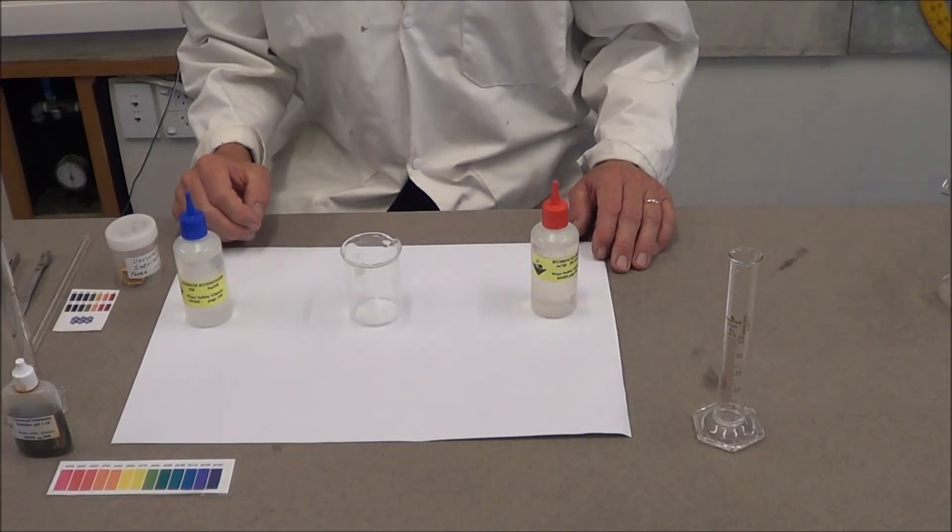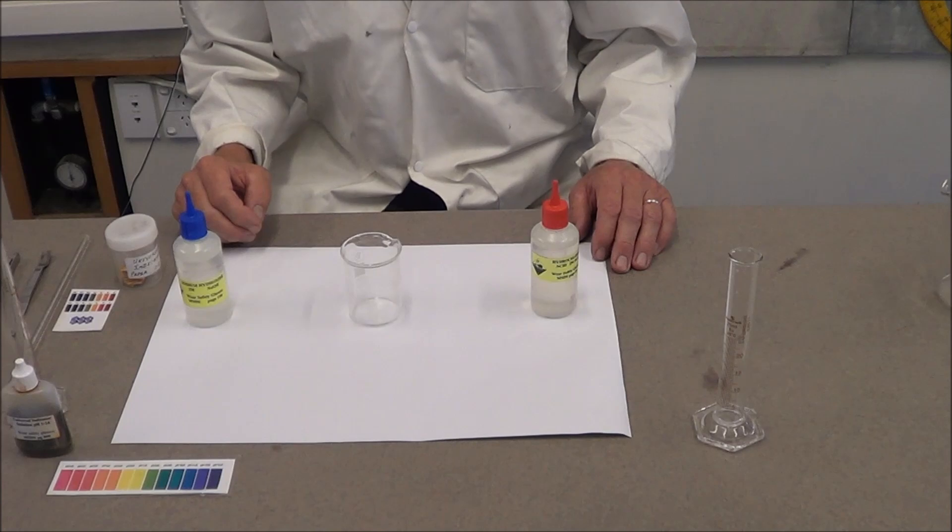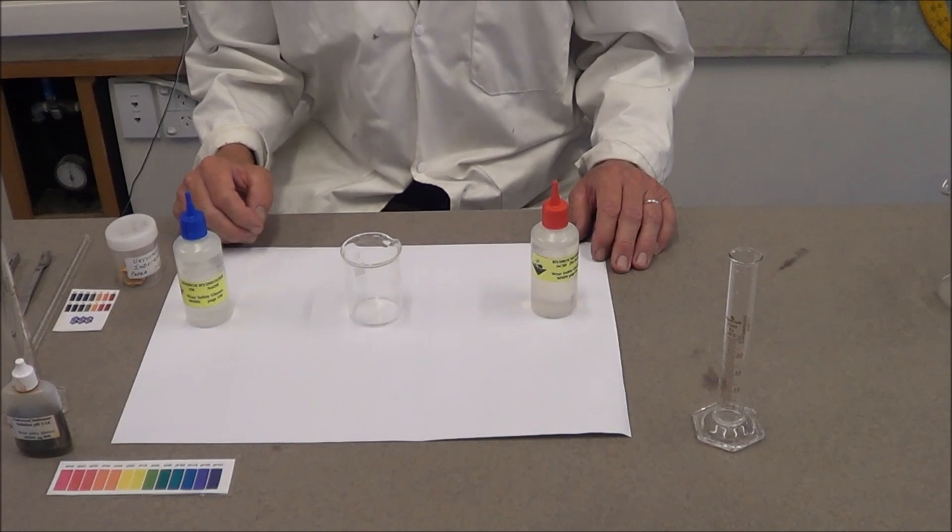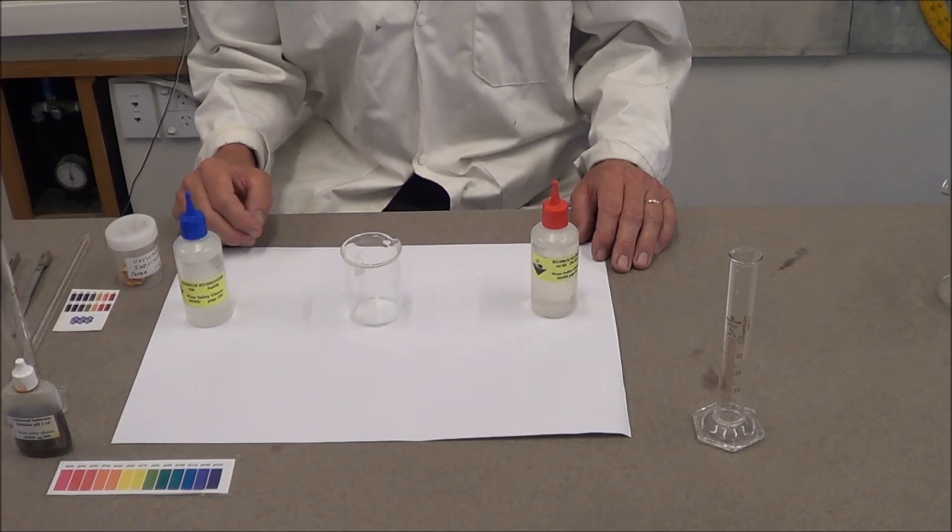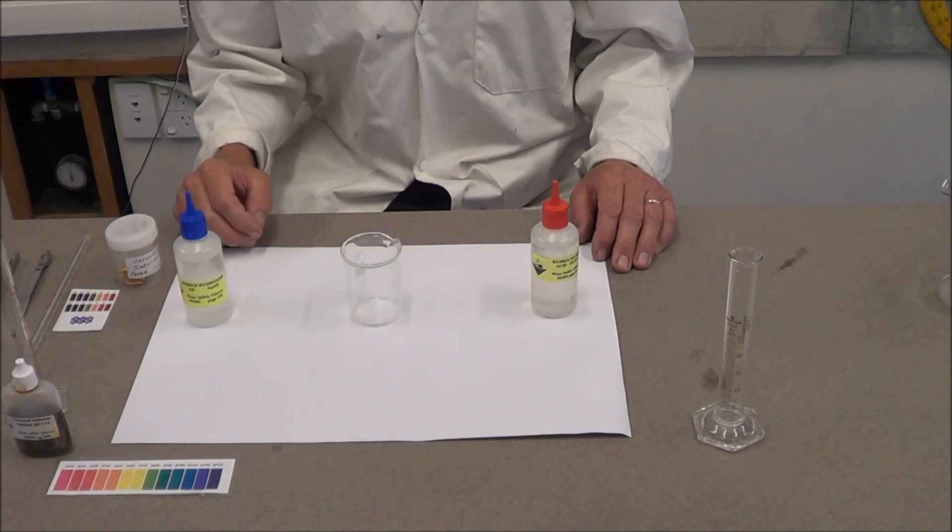In this practical we are going to carry out a neutralization. You need to check with your teacher that you've got all the safety information and filled out the safety slide on the PowerPoint or written down the safety advice in your practical book.